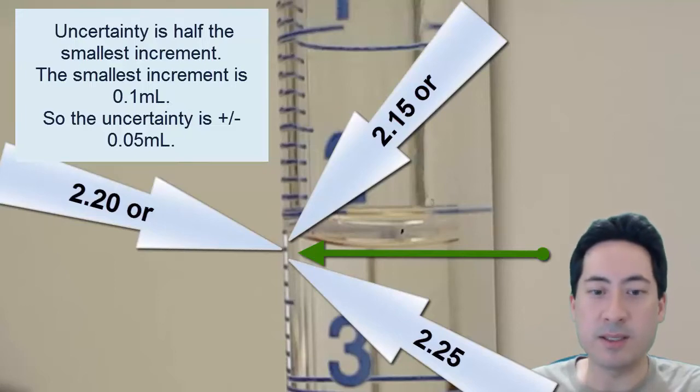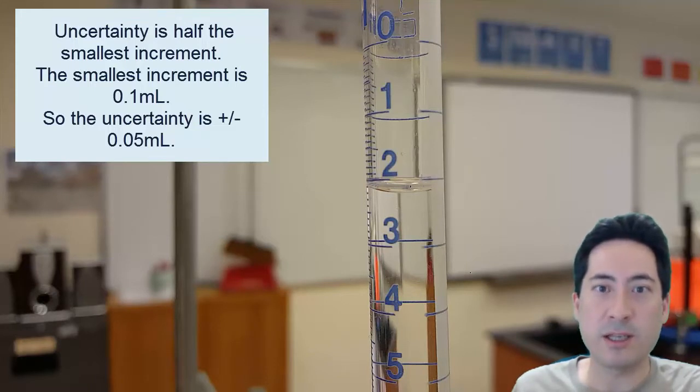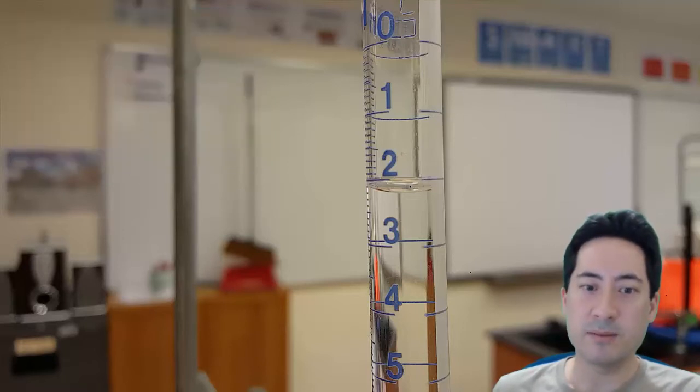And the second biggest error is not getting it to the final drop. And probably the third is making sure you're not trying to catch every particle by using your water bottle to rinse and wash things down and try and get splashes. So I write that down.